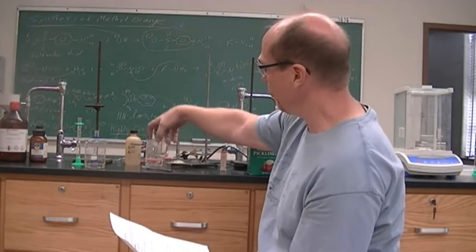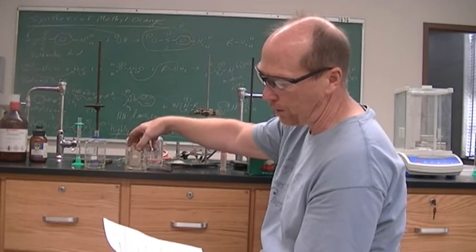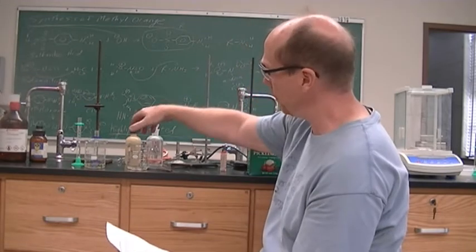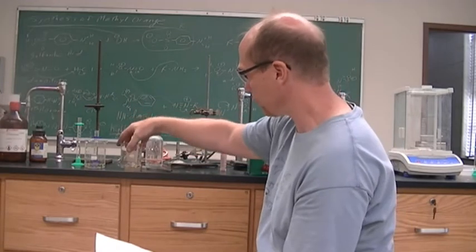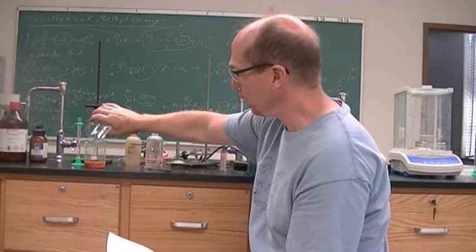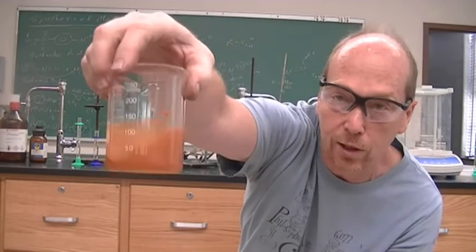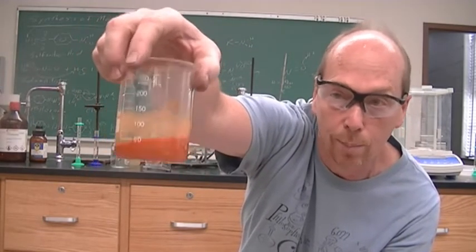In the other 250 mL beaker, I dissolved 1.5 mL of N,N-dimethylaniline in 10 mL of deionized water and 4 mL of 6 molar HCl. And so now I'm going to mix the 2 solutions. That's why I waited for you to see that. Hopefully that was in the camera well enough, that those 2 clear colorless solutions turned into orange, and this is our methyl orange.